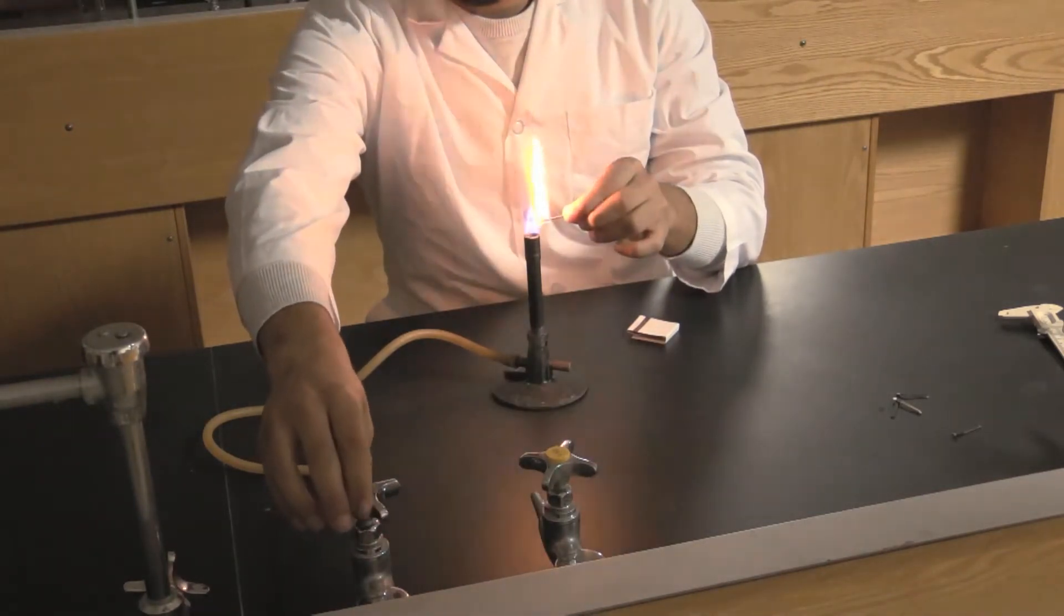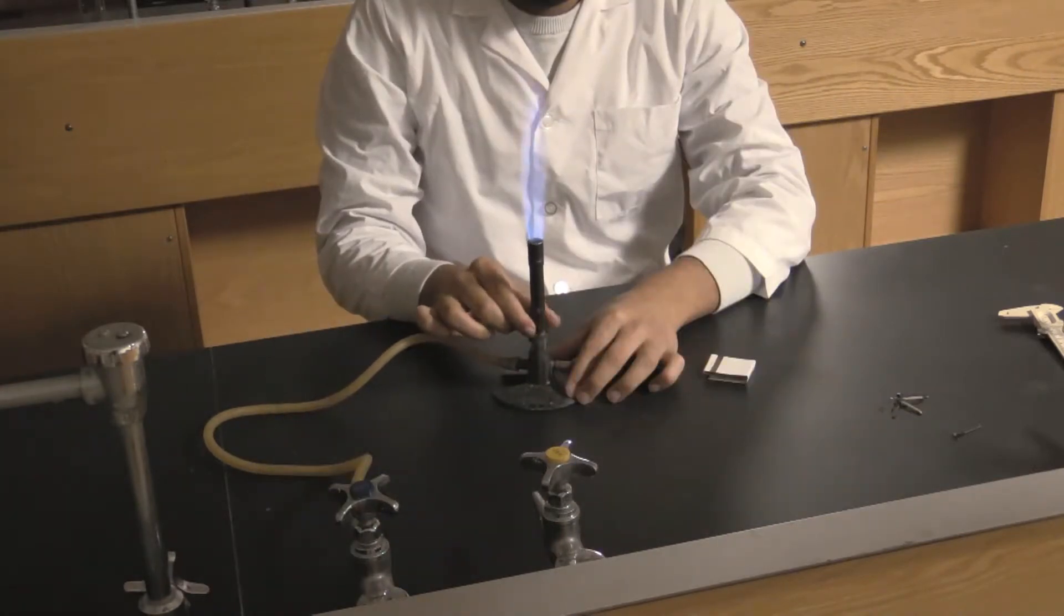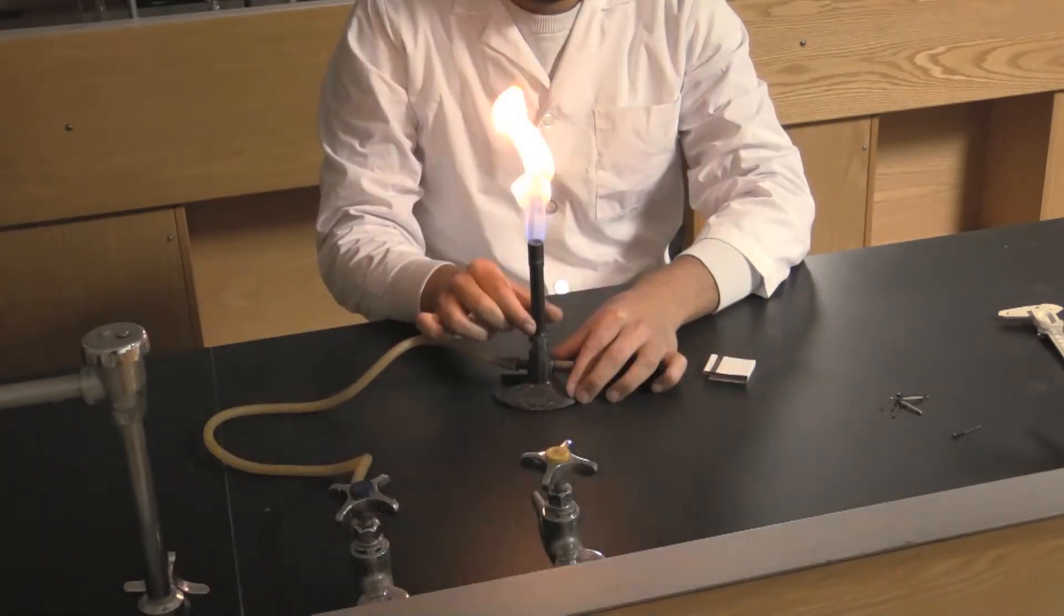Notice that closing the barrel will result in a yellow flame. This is nice for making light, but not for heating a beaker.